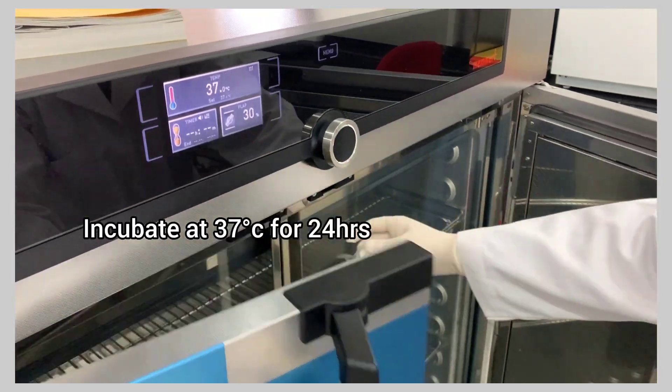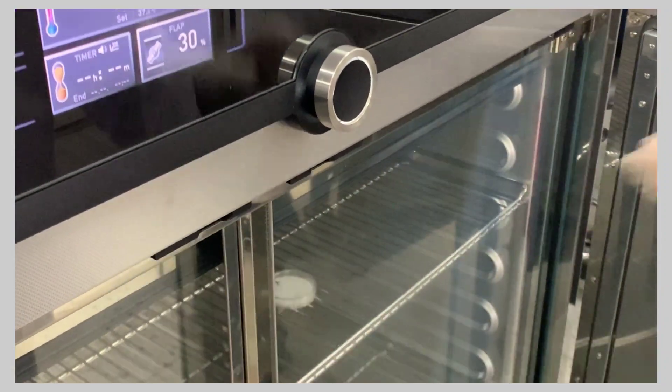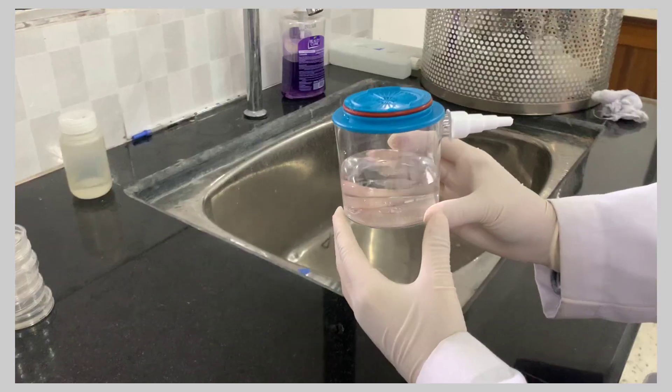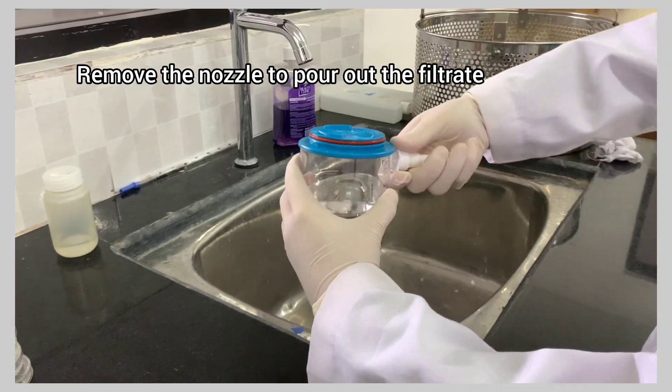Incubate at 37 degrees Celsius for 24 hours. Remove the nozzle to pour out the filtrate.